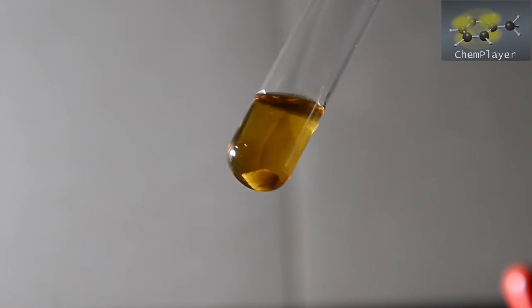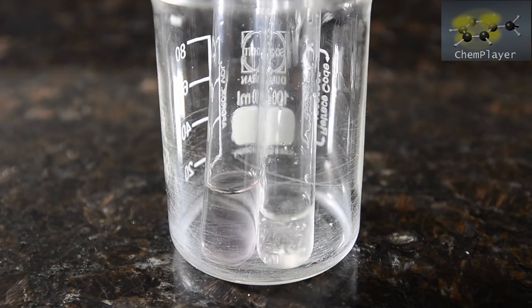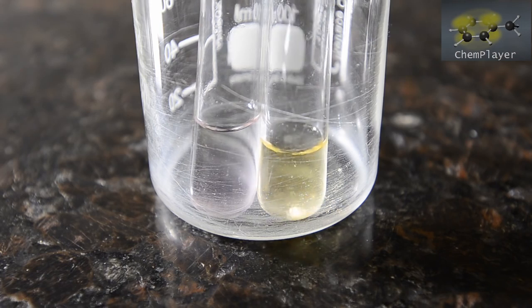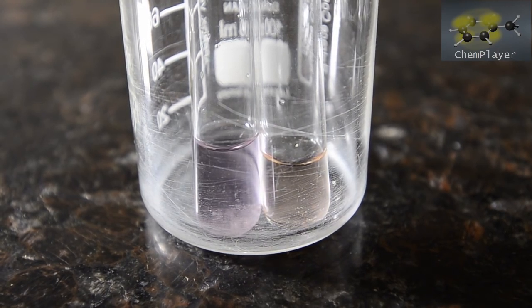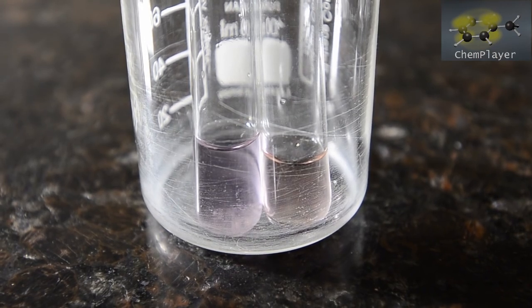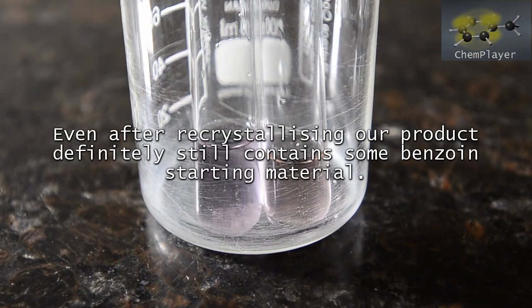So we repeated the test only using a very small amount of our product material, again with some ethanol and a few drops of sodium hydroxide solution. The mixture remained yellow for about 20 seconds, and then we've got the purple color. So this definitely shows that our product still contains some benzoin as an impurity.